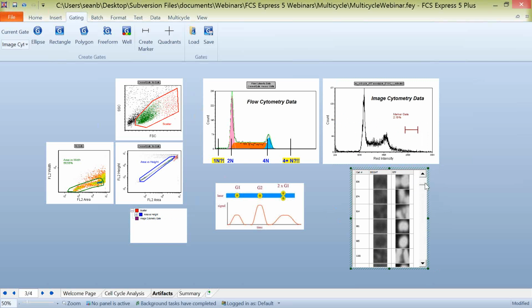The other thing that you can see in some of these is that in some cases, multiple cells were collected here as part of the segmentation routine. In this case, 3 cells were collected. So these are all things that you may want to exclude from your analysis before you begin.